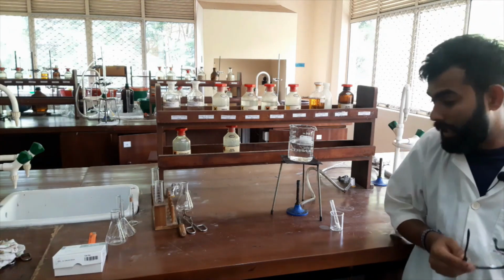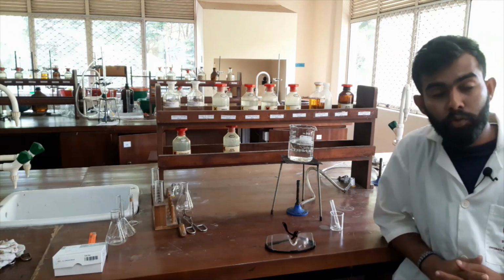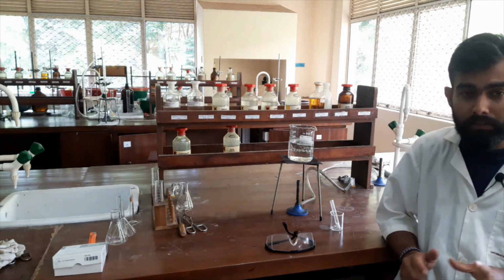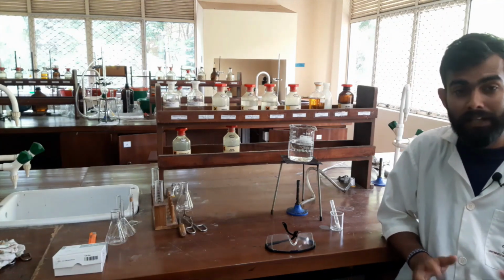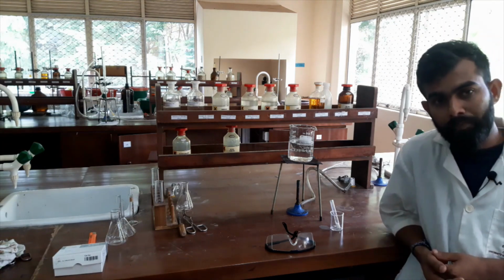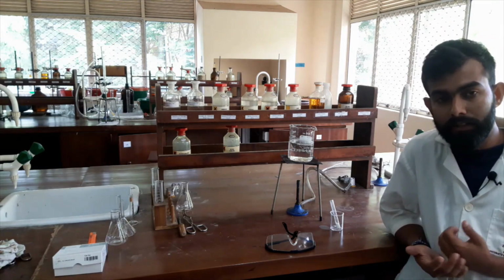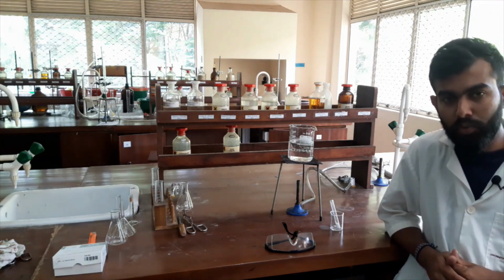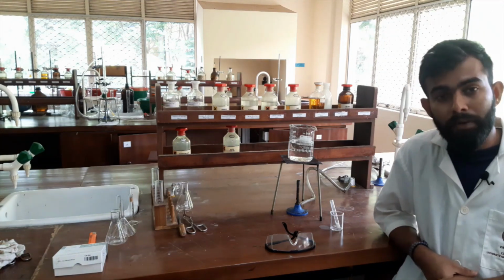I am Hasanga Kalingwarachi. Today I am going to do a very important experiment in organic chemistry. So it is recrystallization. I will explain what recrystallization is and how to do recrystallization very clearly and properly, and all the techniques I will explain to you. Please remain with me. I am Hasanga Kalingwarachi.